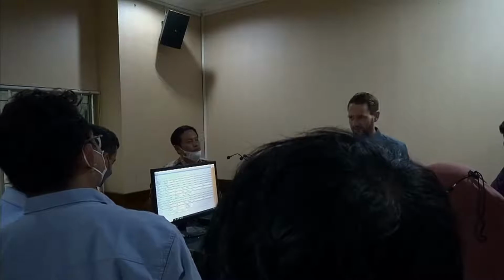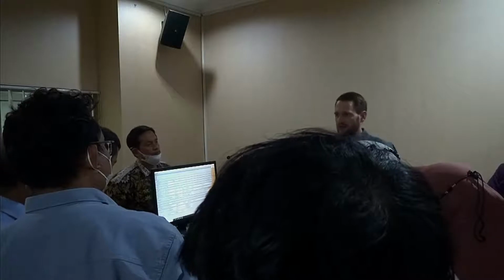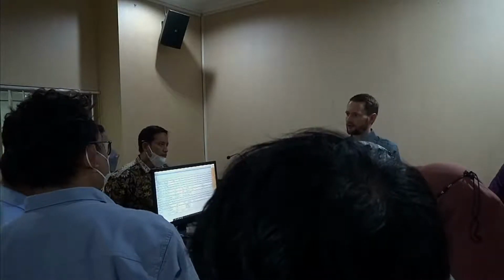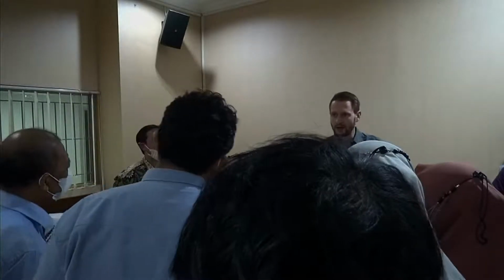So if anybody tells you they can do it with a laser particle sizer, no, they can't. They can maybe find an approximation just as we can. We can load a result of any measurement into this MieSearch software, and then we can enter certain areas or certain numbers. For example, look between 1 and 3 for the refractive index, and it will go through all the different values, calculate the results, and look where the error of the measurement is minimal. And then it will give you this value.